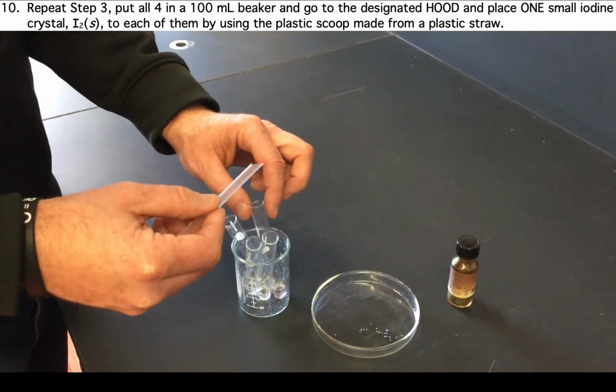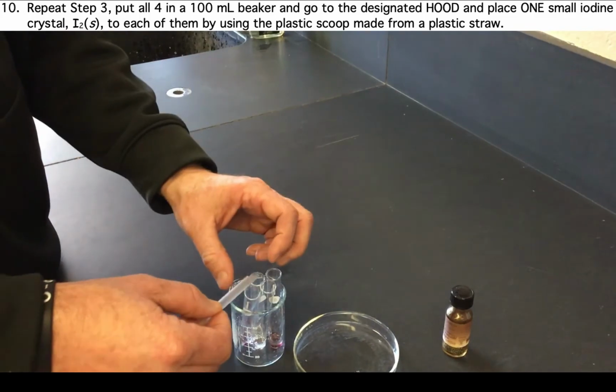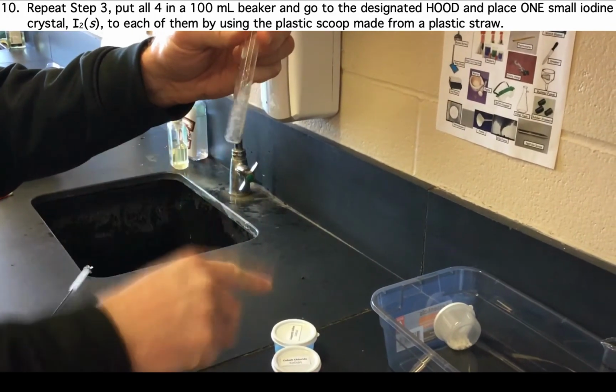Now we will add an iodine crystal to each of the 4 unknowns, finger tap, make observations, and record these observations in the data table on page 4.